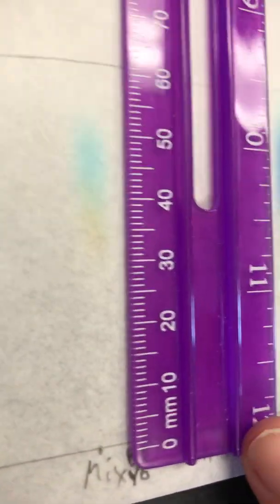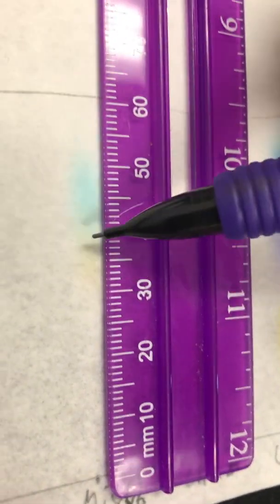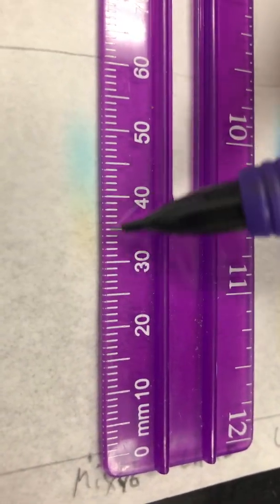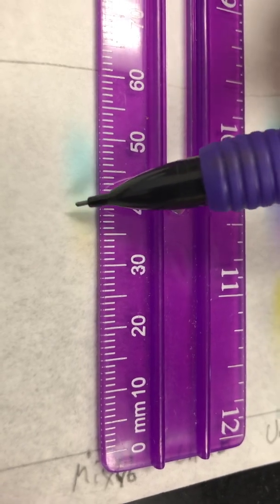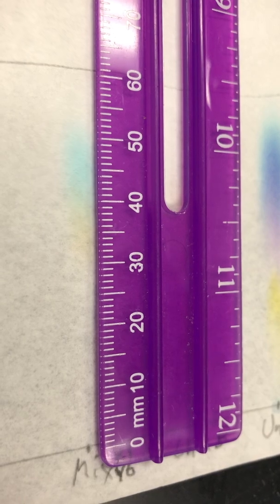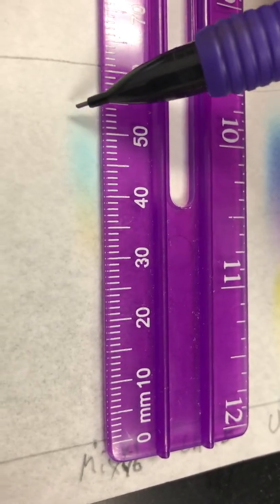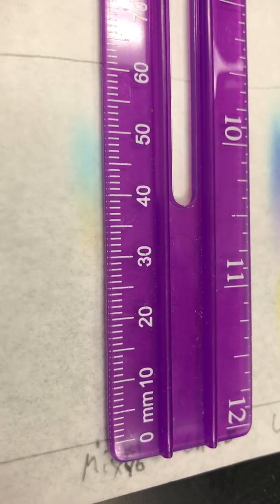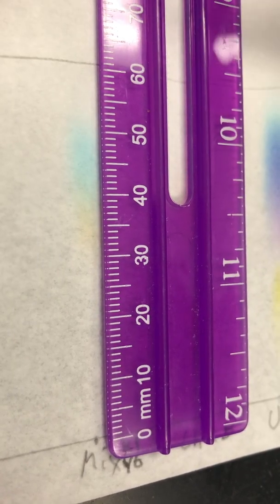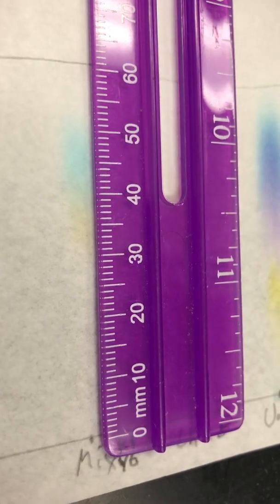All right, the mixture. So you already remember, we know what the mixture is. So here's our yellow 6. It's right up there next to it. So this is probably right here would be the top of the yellow 6. It's a little hard to see. Here would be the top of the B1. And here would be the top for your solvent front, for your D solvent.